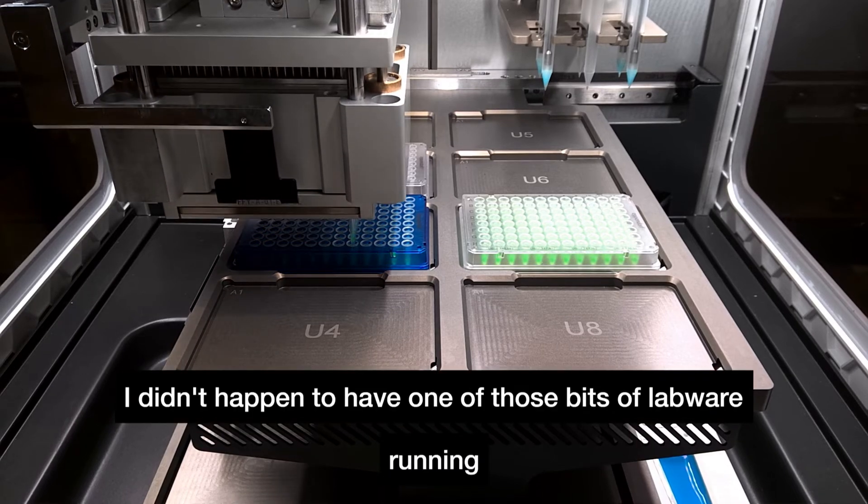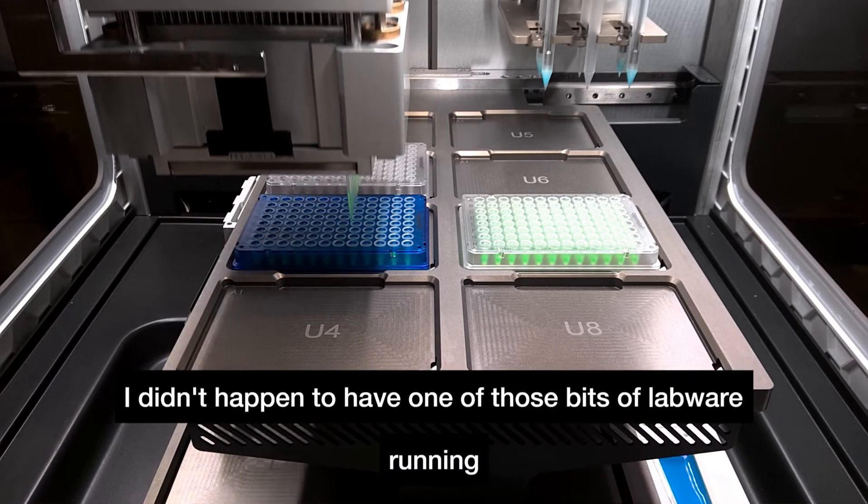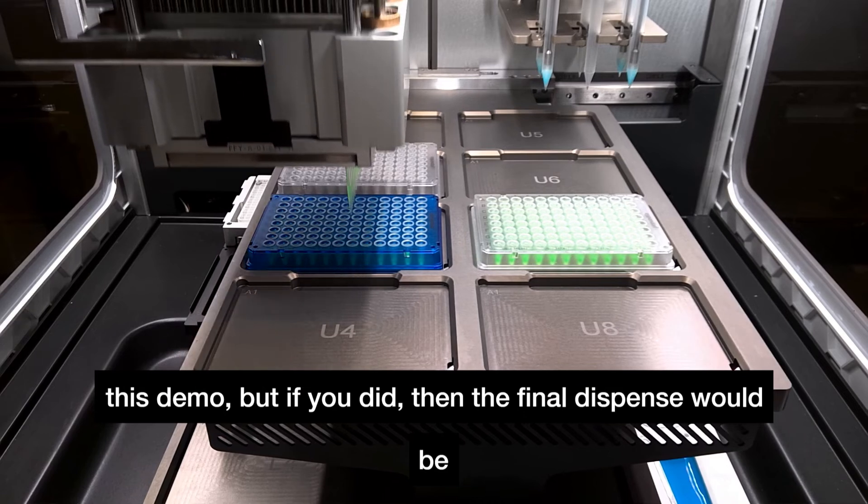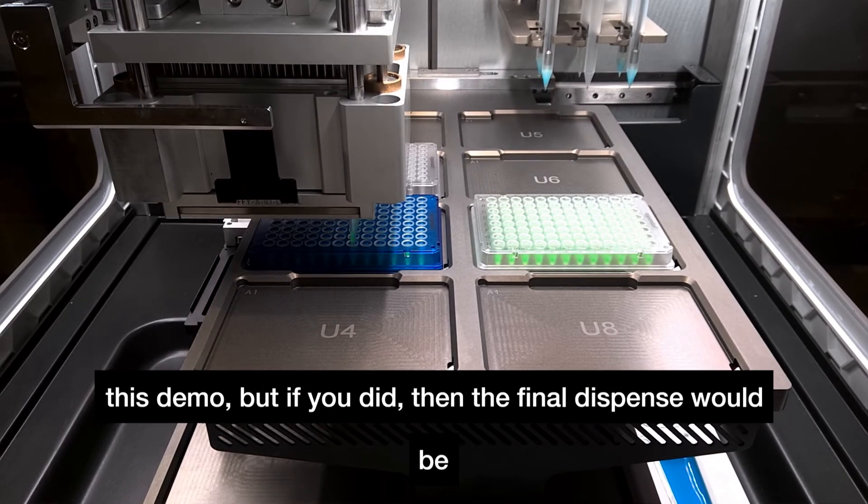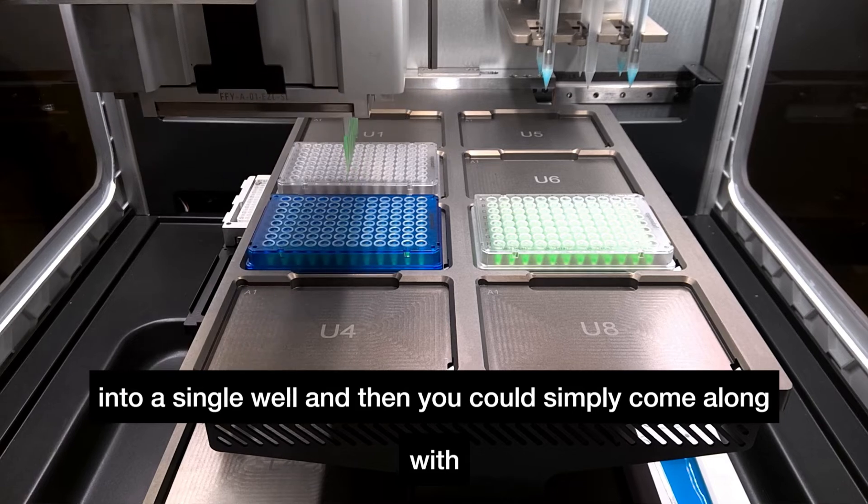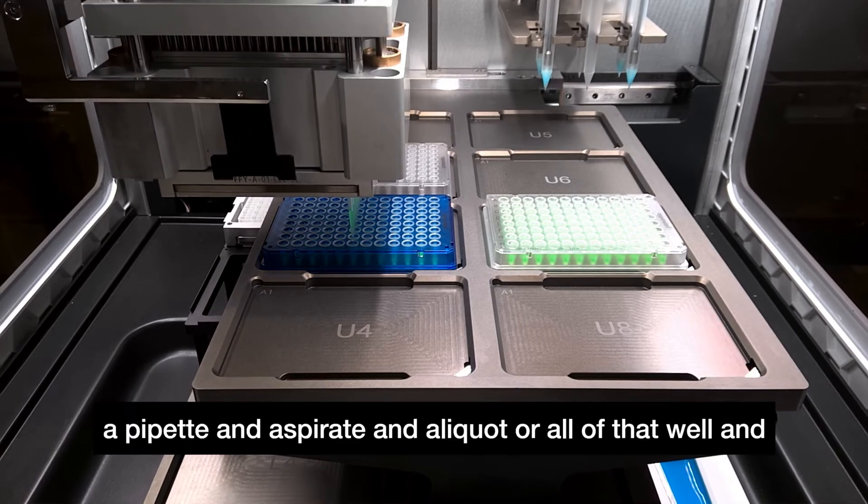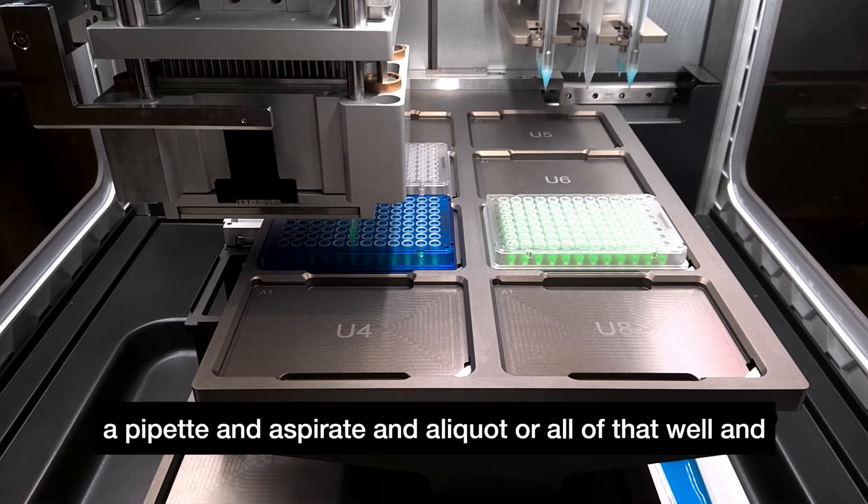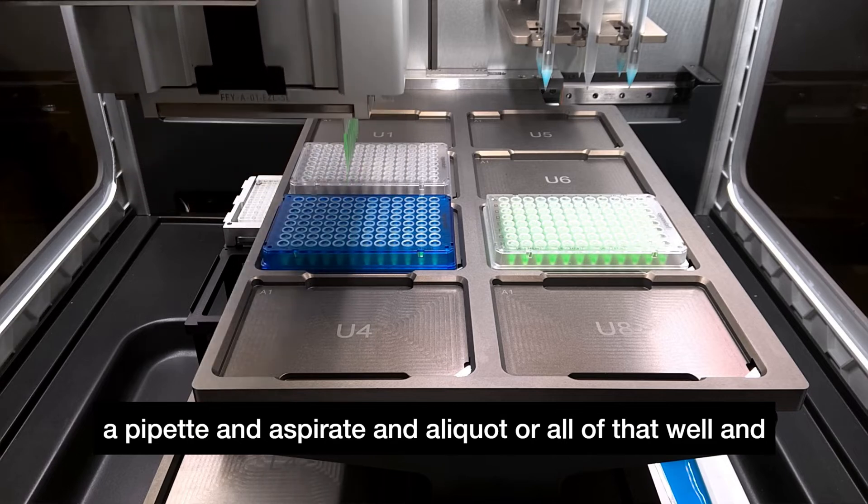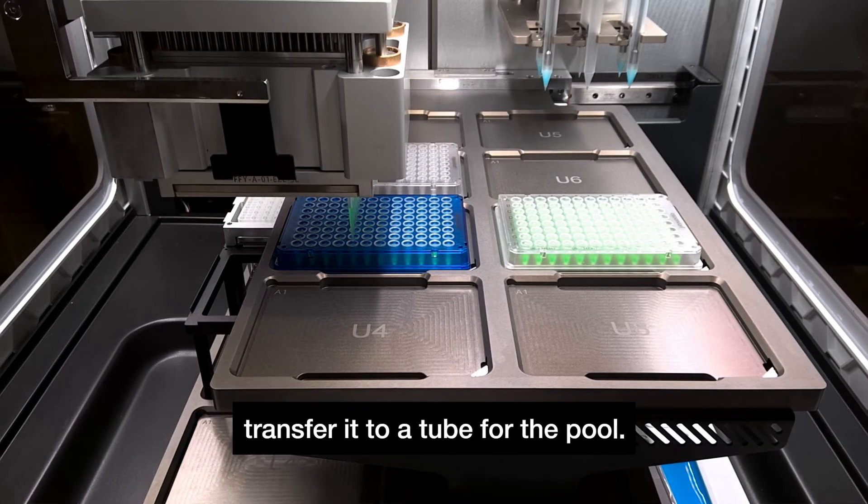I didn't happen to have one of those for this demo, but if you did then the final dispense would be into a single well and you could simply come along with a pipette and aspirate an aliquot or all of that well and transfer it to a tube for the pool.